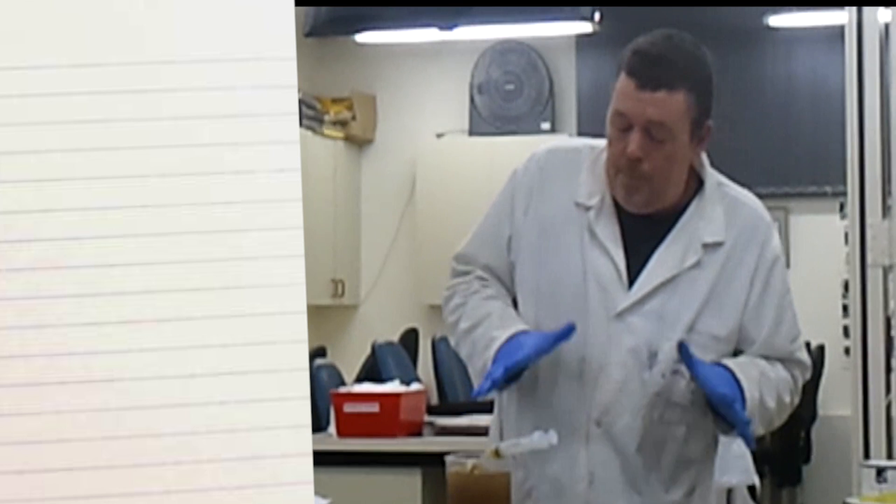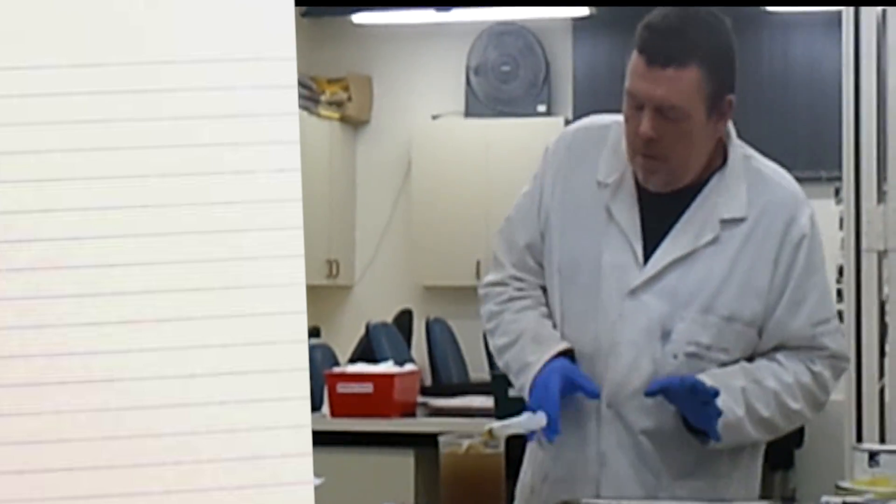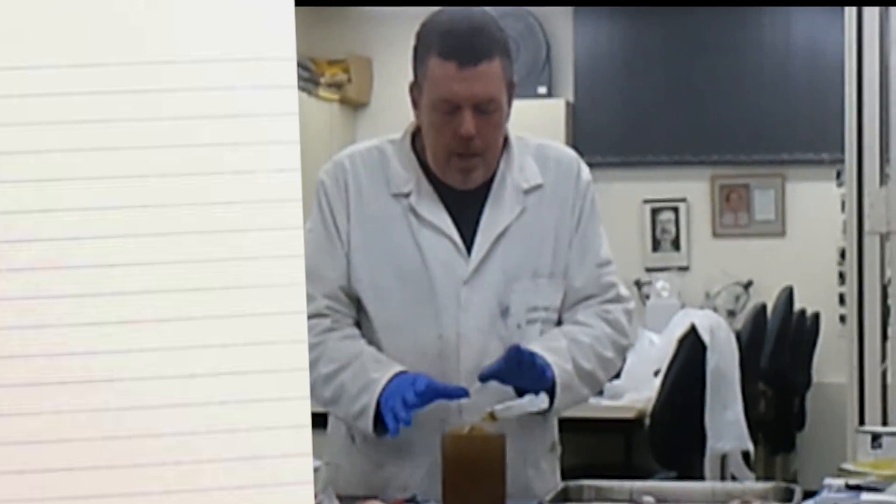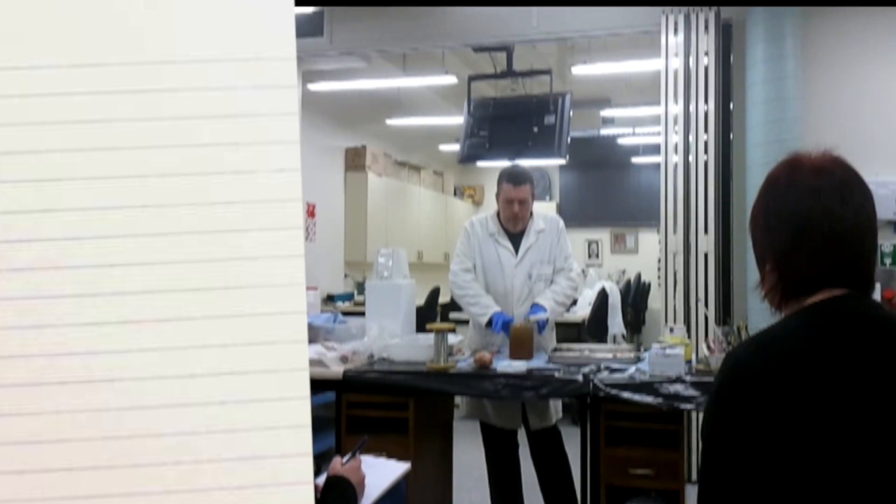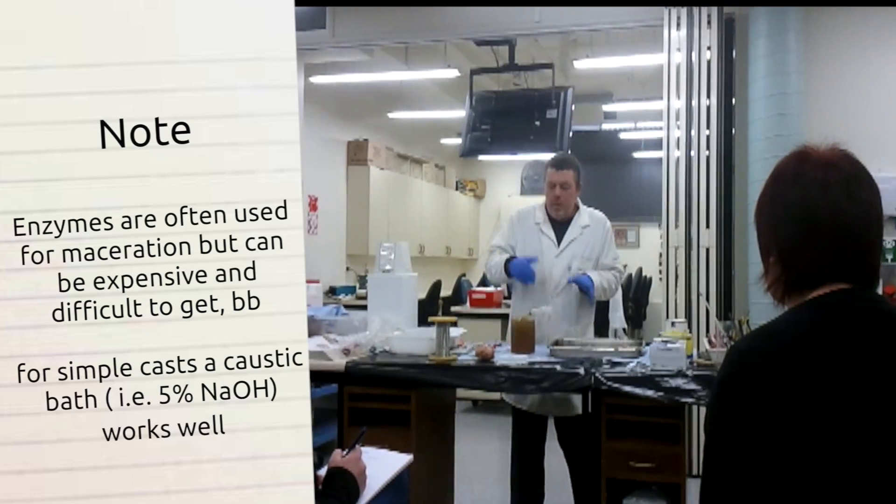What I've been using, as I said, is a 5% sodium hydroxide mix as a macerant. Once that resin is set, you can put it immersed in. I always make sure I've got a much larger vessel, at least 3 quarters larger than the specimen.